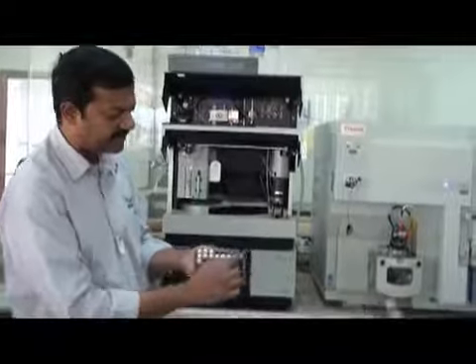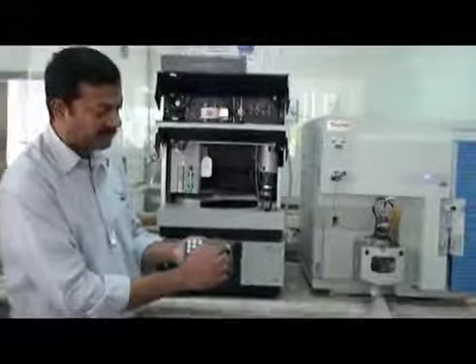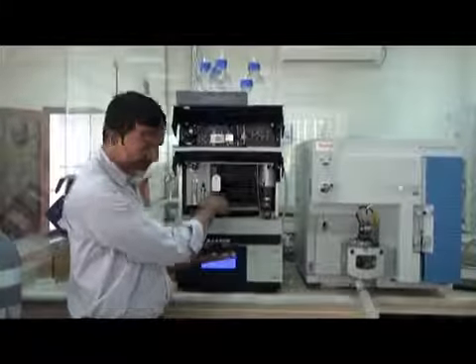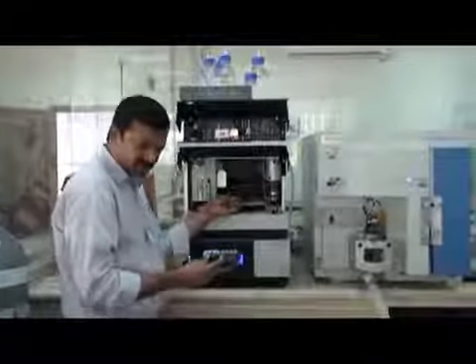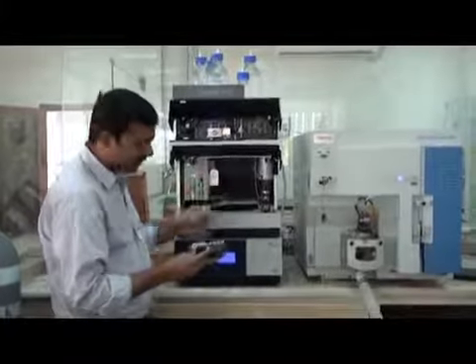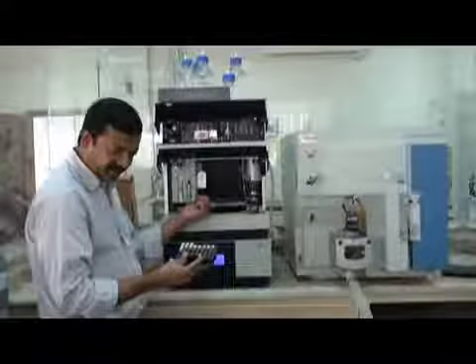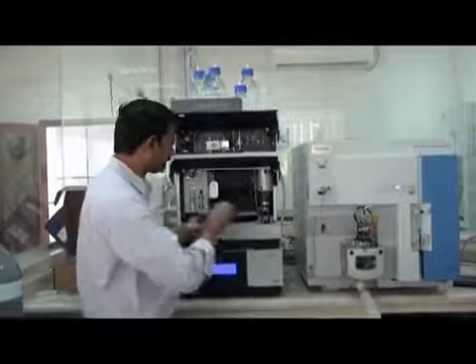Like this vial you take, this is in the B line and the last vial is 8. So the position will be B8. This is the same in the other trays. Since I put this tray in the red position, if you come here you can see R written, and the color is also red. So this one will become RA1. If you put the same in green, it will be GA1. Very clear. When we put it, it will be more clear.